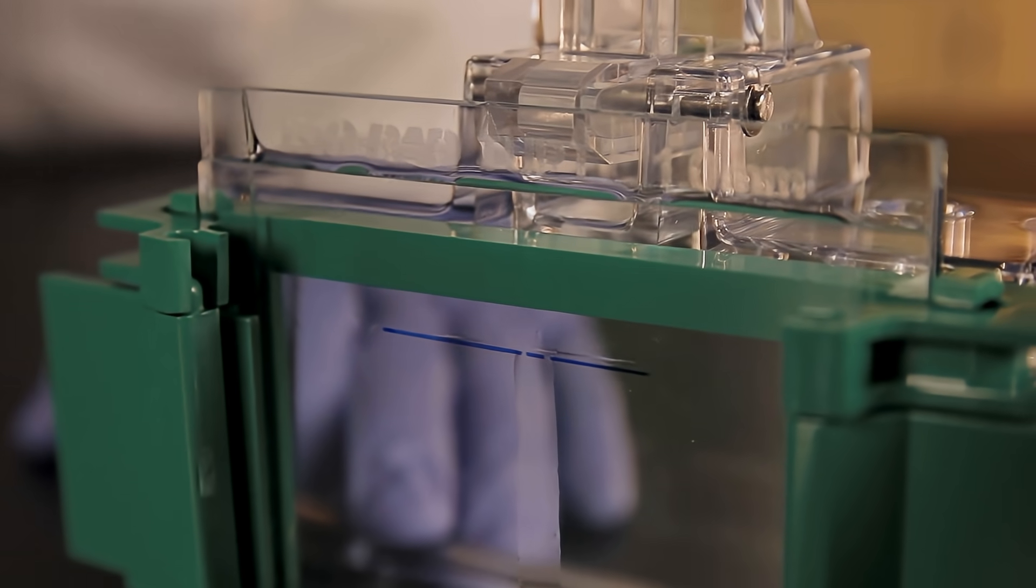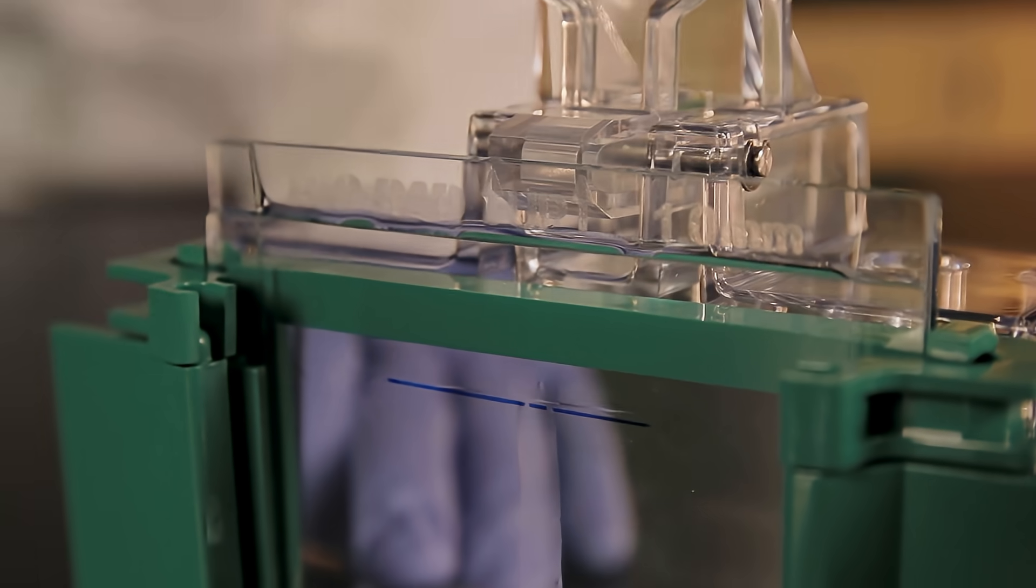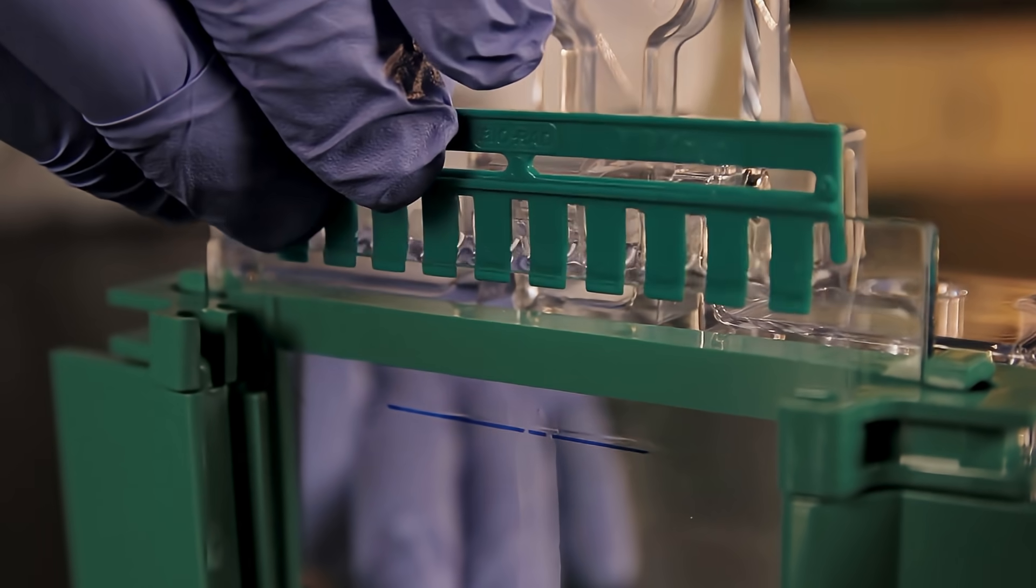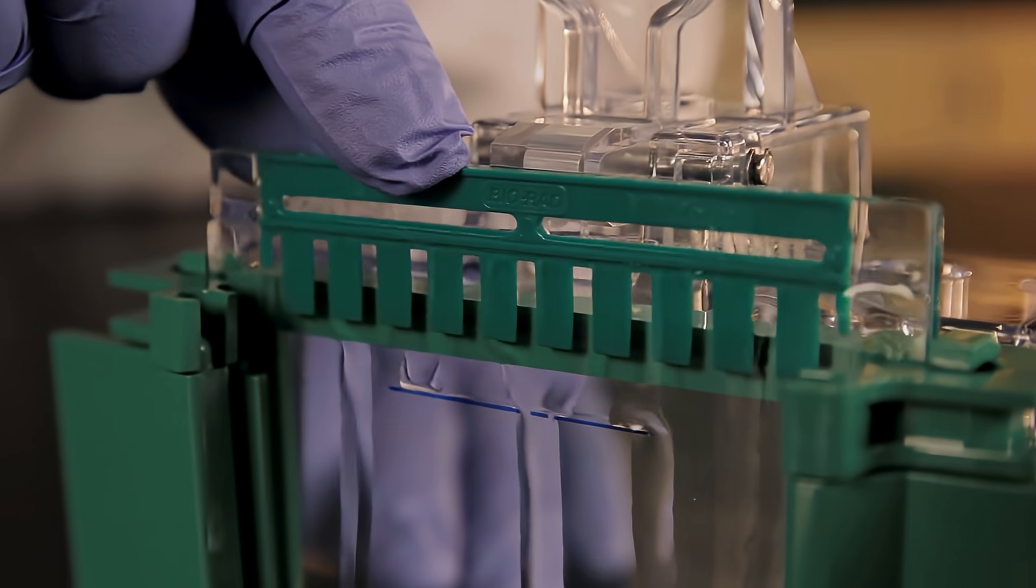Insert the comb into the cassette, taking care to avoid trapping air bubbles under the teeth. Allow the gel to polymerize for at least 30 minutes.